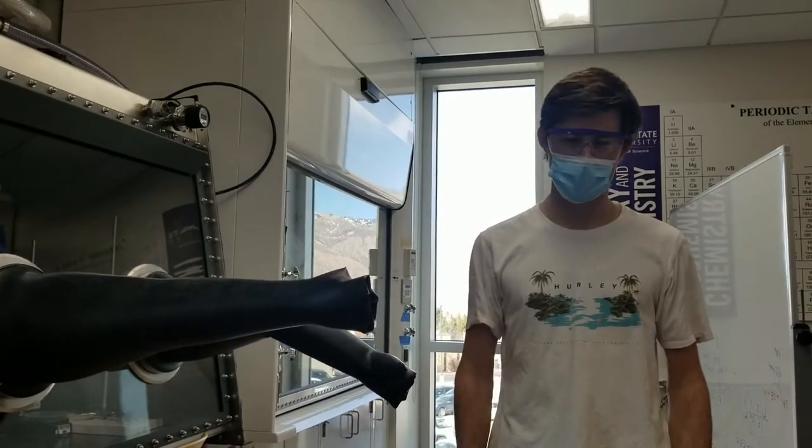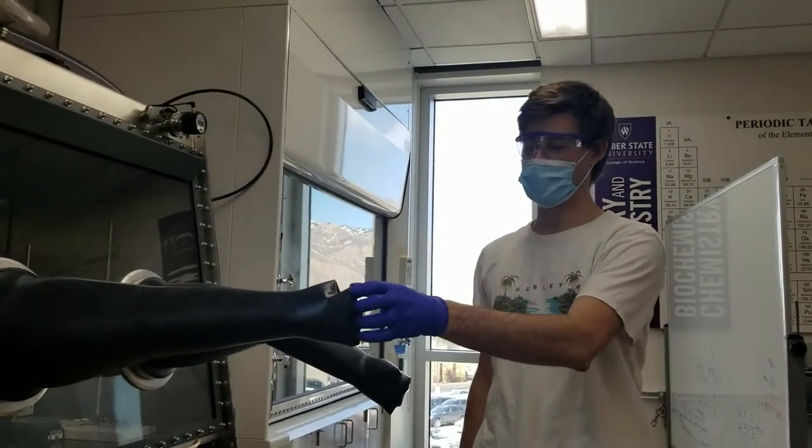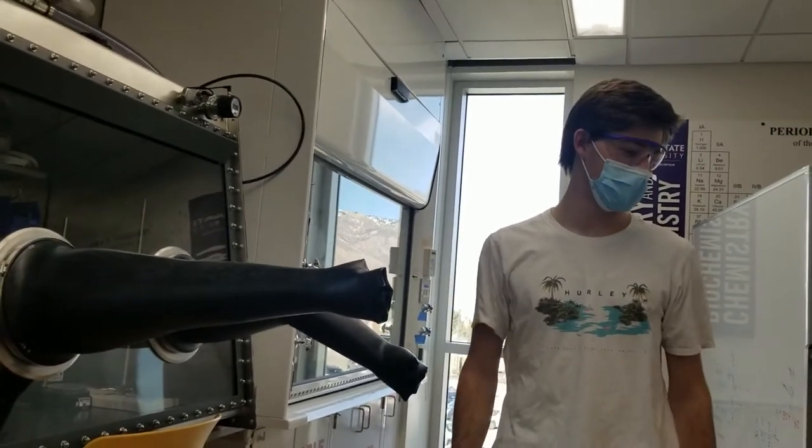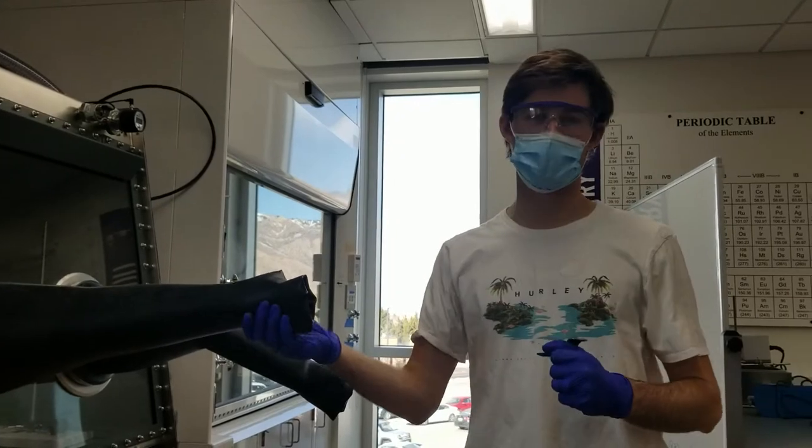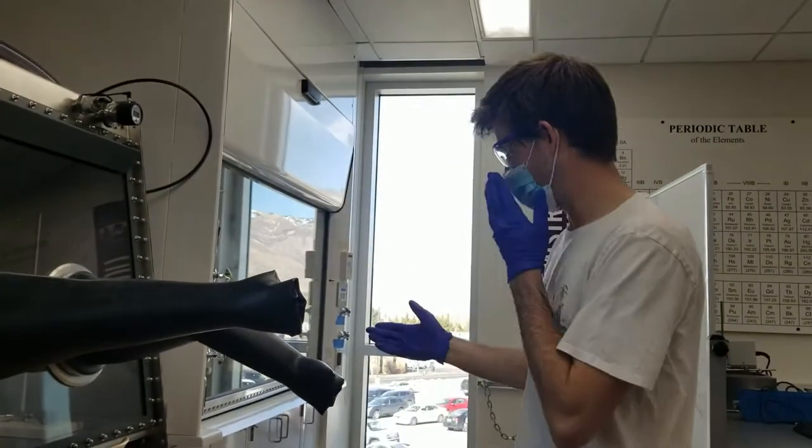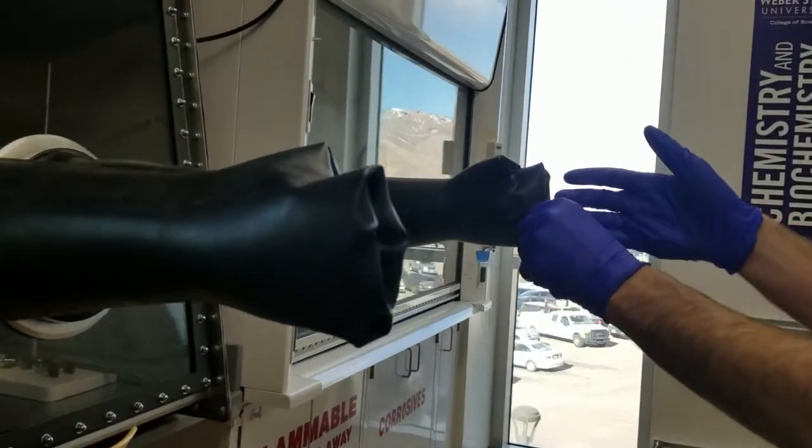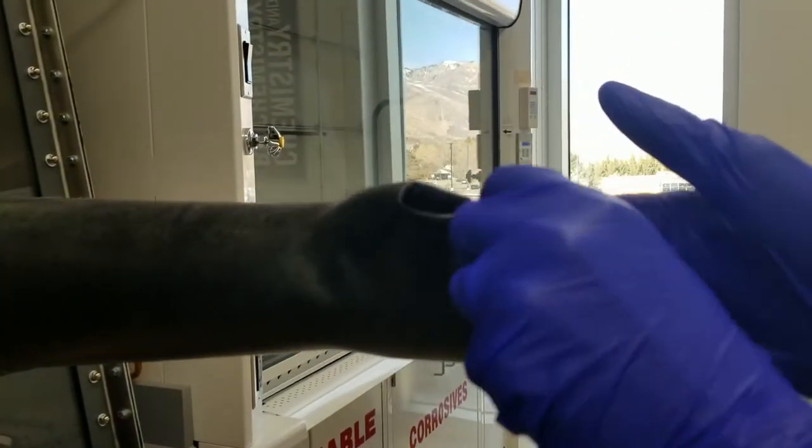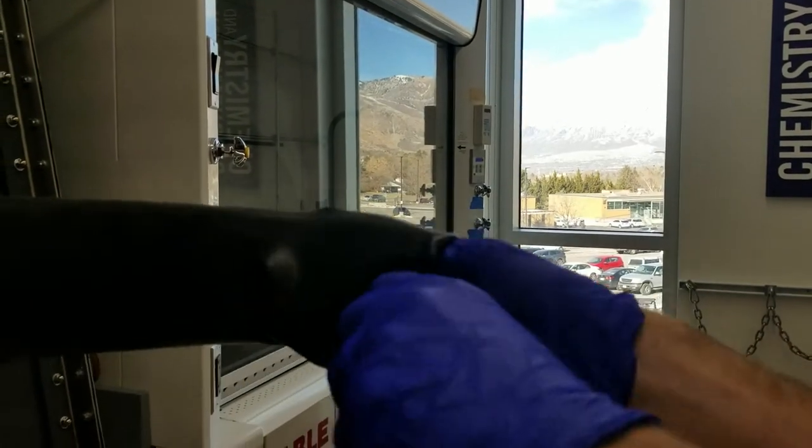When putting on the gloves, you want to make sure you're wearing gloves first off to make sure that they're clean and sanitized. You also want to take off any watches because that could potentially puncture the gloves and these are very expensive. When ready, you want to put your fingers in each of these holes and get situated. If your hands are too big, that's just unfortunate.